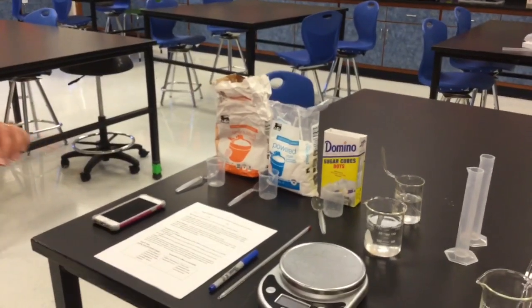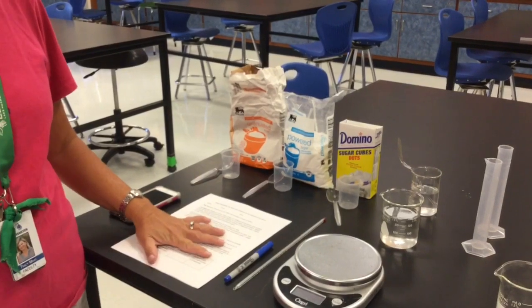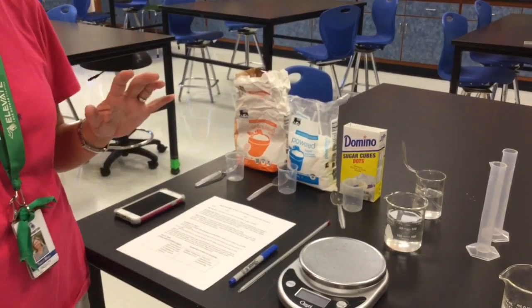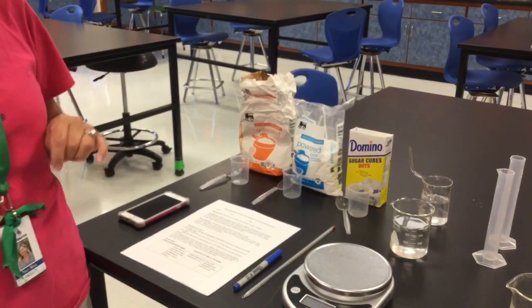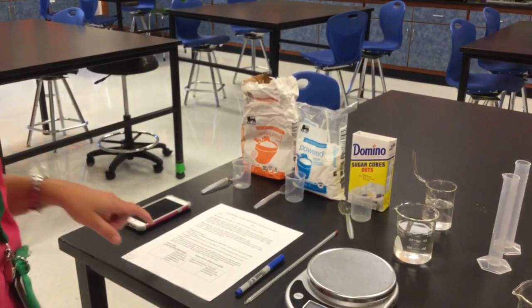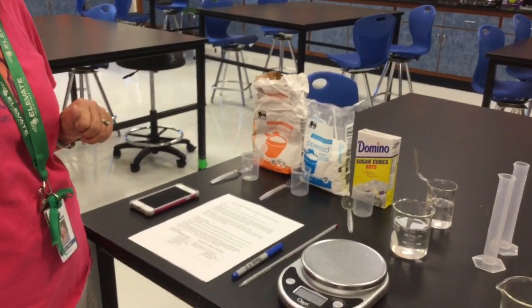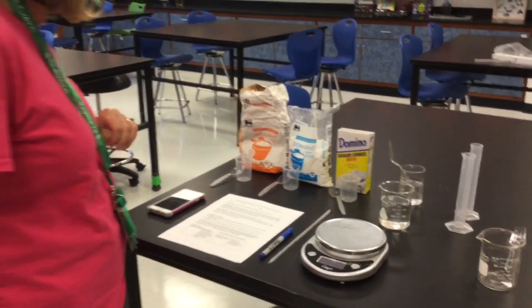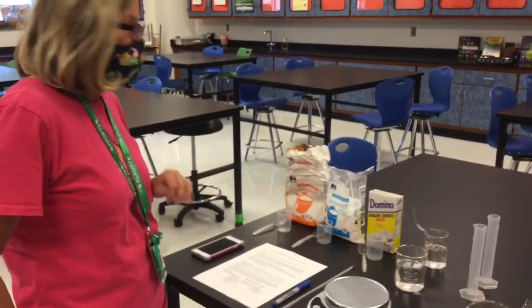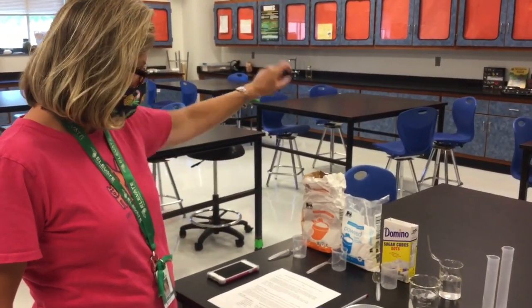Okay? So, data collection. Again, we're going to be writing on our data table. We're going to be showing it to you so there's no confusion, and you're simply going to be filling in your data table as you watch this video. So it's very important you pay close attention to the steps of this procedure for each trial. We're going to have 3 different trials. And please note that cold water is just water straight from the faucet, and our warm water is going to be back there off of the hot plate.